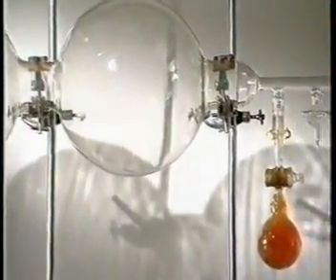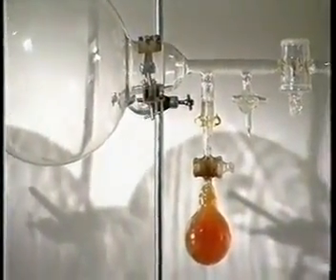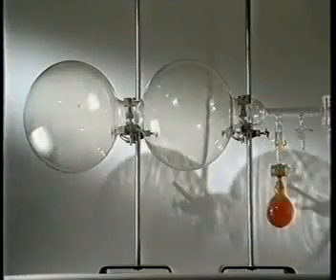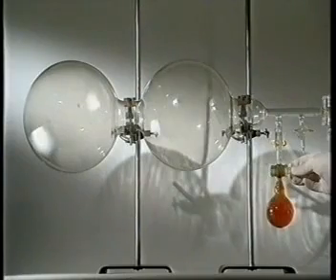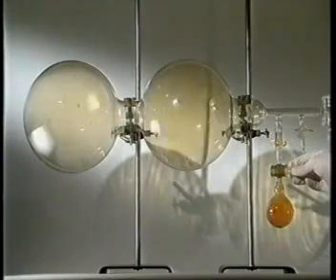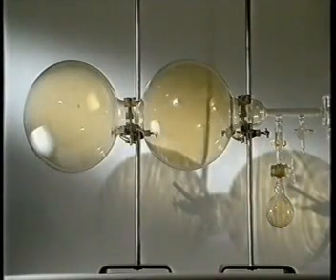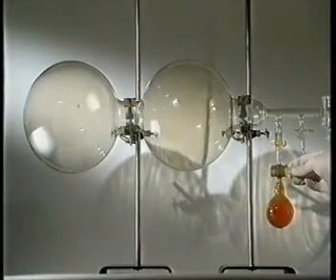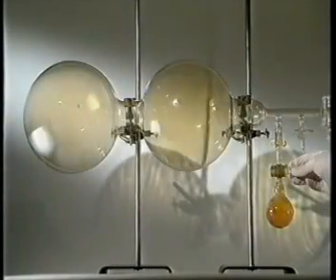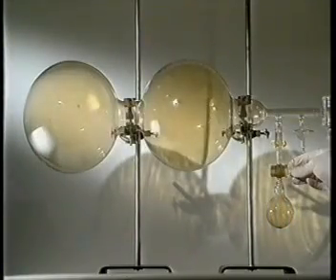All the air has been removed from this apparatus, apart from the flask containing bromine which is isolated by a tap. Open the tap and it spreads immediately. In a vacuum there's no air to collide with, so the bromine diffuses much faster.